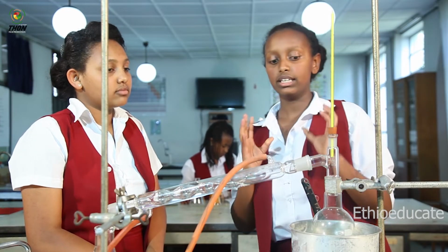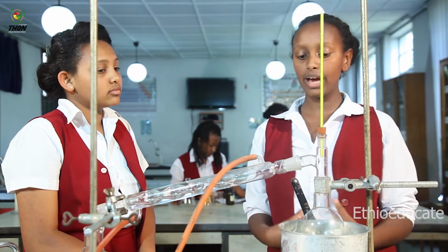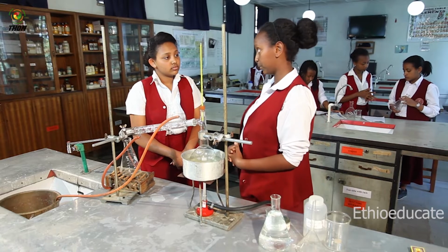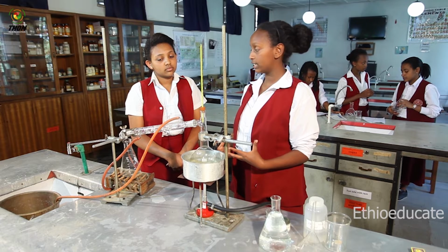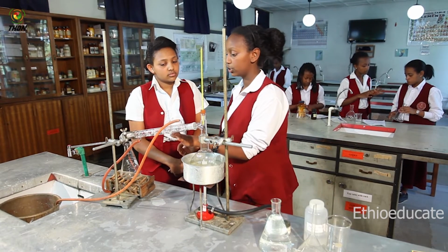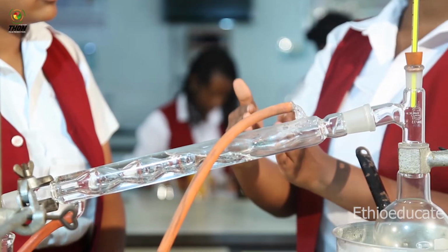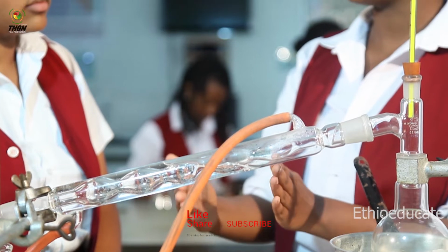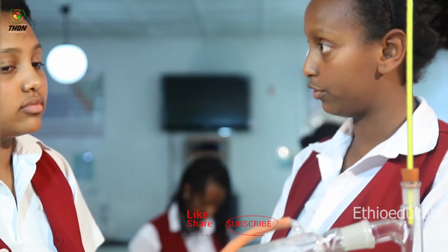So, now let's look at the theory behind simple distillation. When we have a mixture of liquids to be separated, as the temperature rises on that mixture, the more volatile liquid will evaporate first, and it will pass through a condenser tube such as this one, and the cool water coming through it will condense it and turn it back into its original form, which is a liquid. So we will have a liquid at the end of the tube.